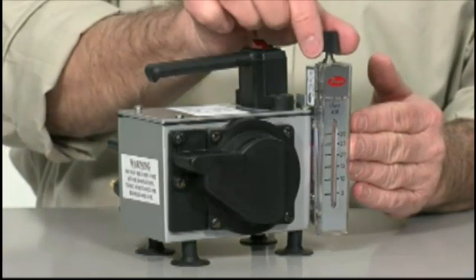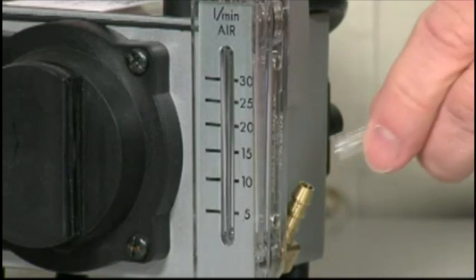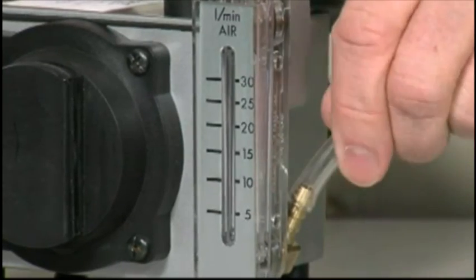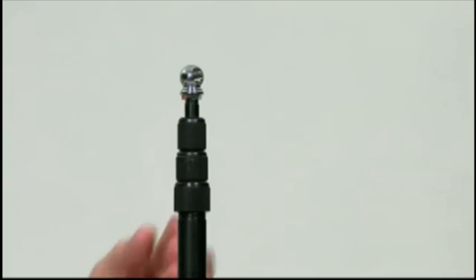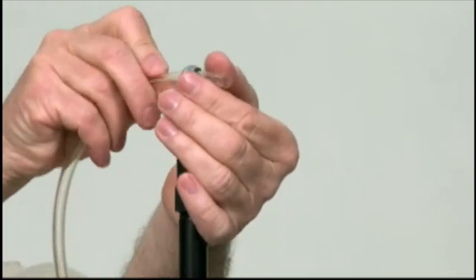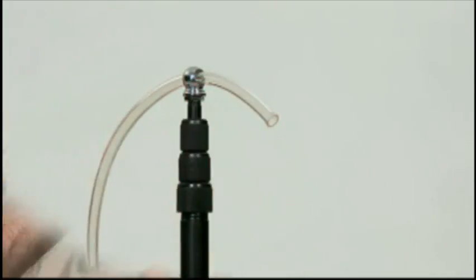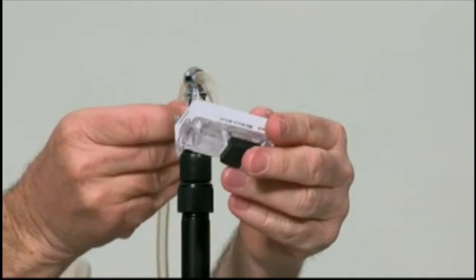The Allegro D2 pump is a linear style pump that offers quiet performance with a built-in flow meter. The primary function of this pump is to collect mold using any of the mold cassettes available. Just attach five feet of tubing to the inlet. Next, attach the other end of the tubing through a stand. Attach the cassette to a tube and you are ready to go.